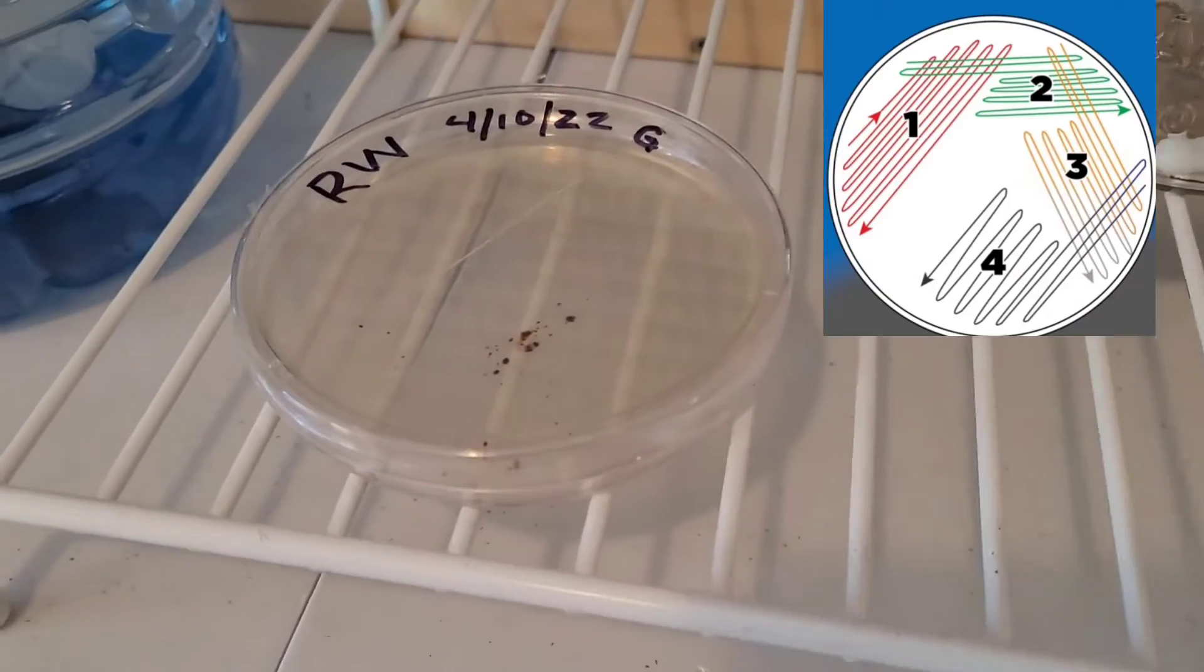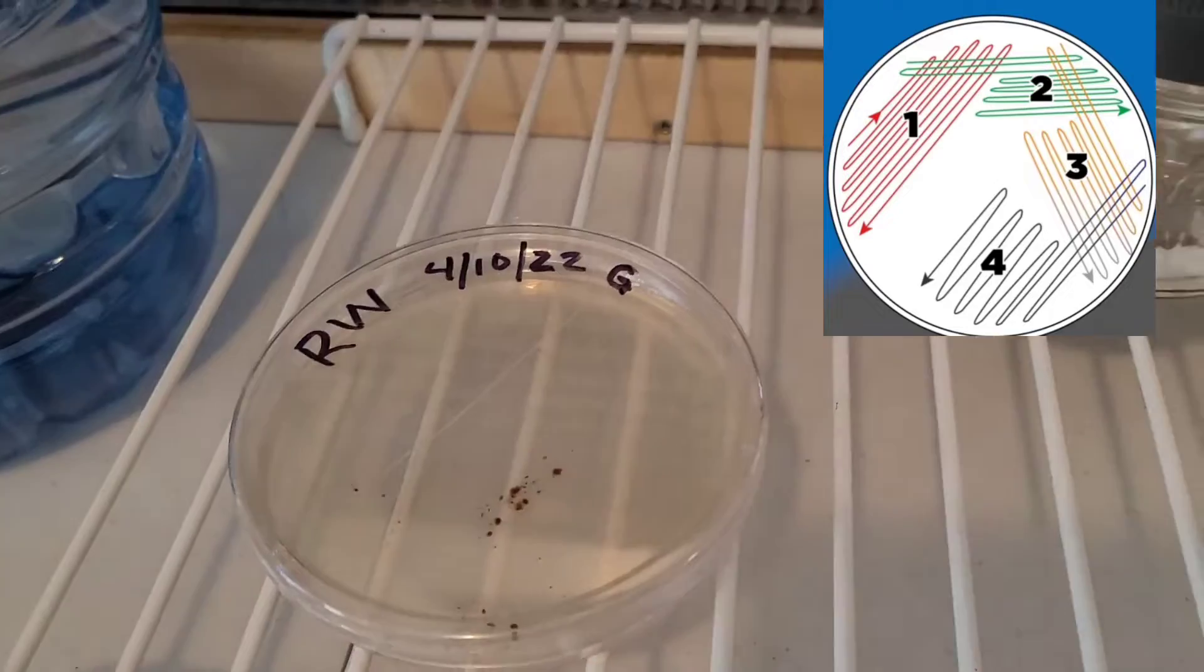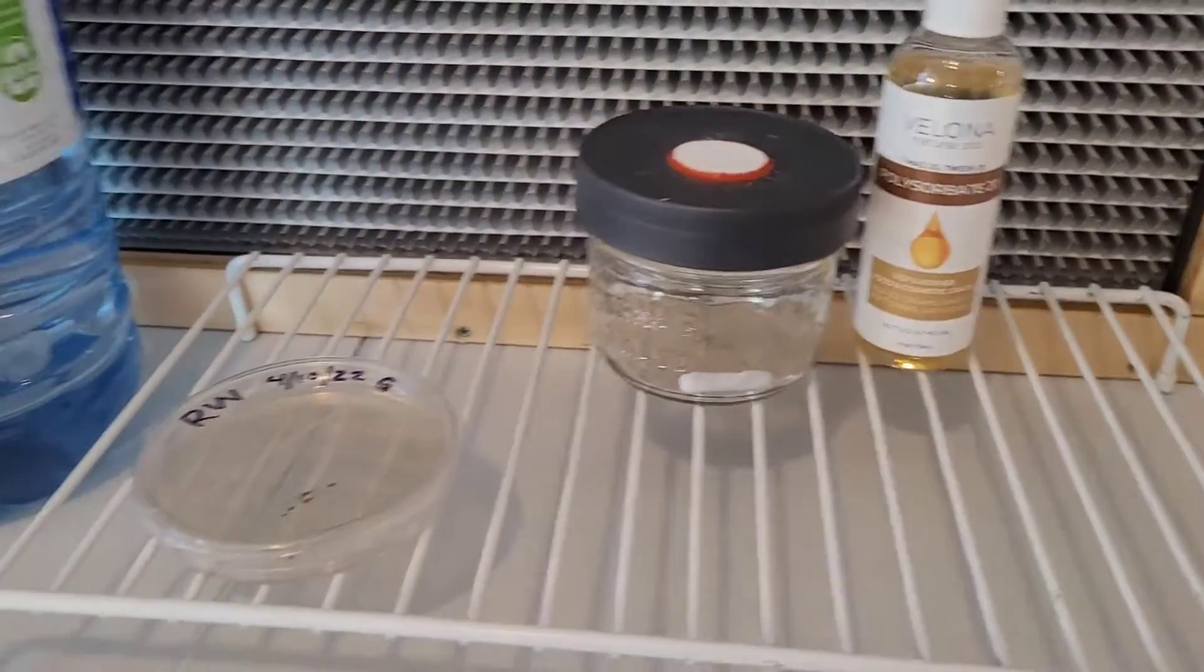I'm going to be using the proper quadrant method for streaking. I'll document that as well so you guys can see what's going on. Anyways, that's what I'm going to be up to.